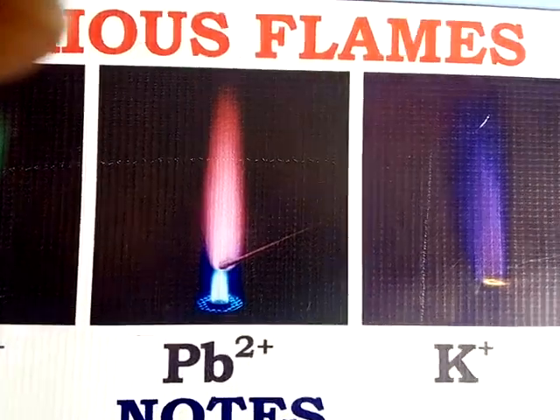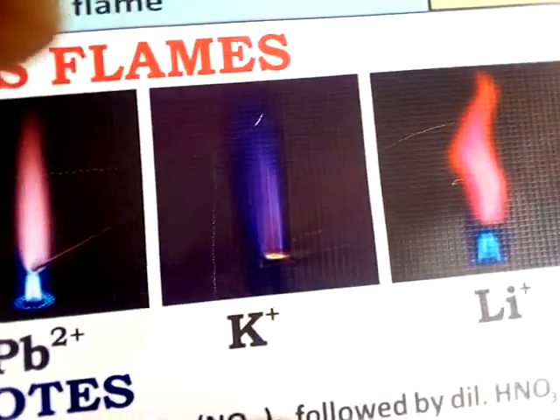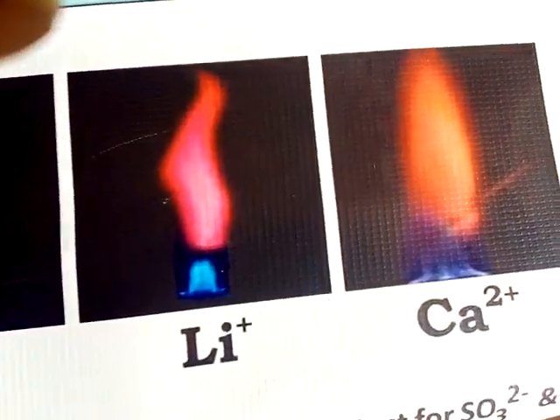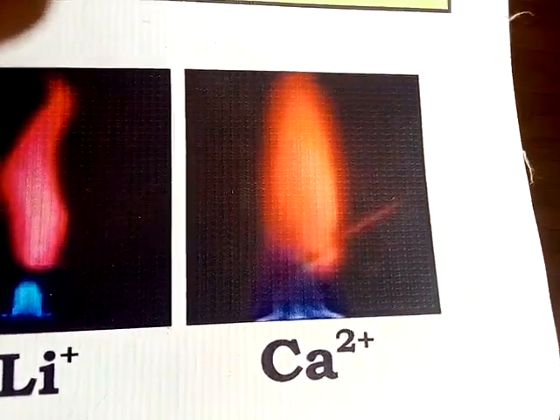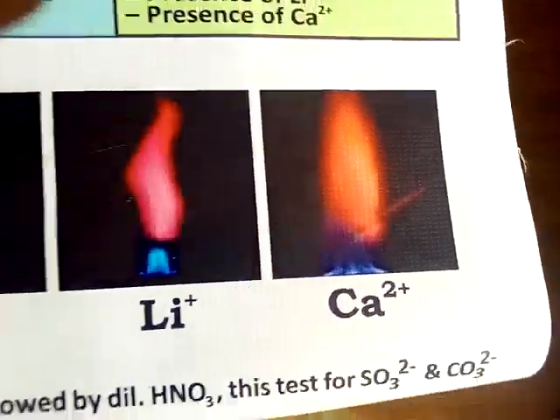What about lead? That is it. What about potassium? Purple — you can see those are potassium ions. Lithium and calcium ions are also present.